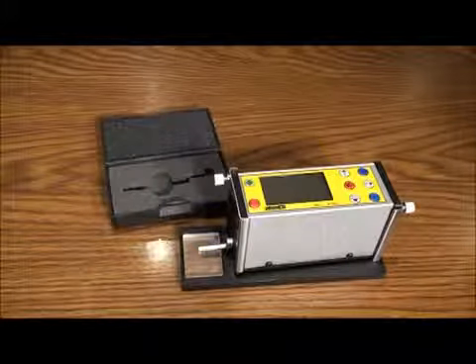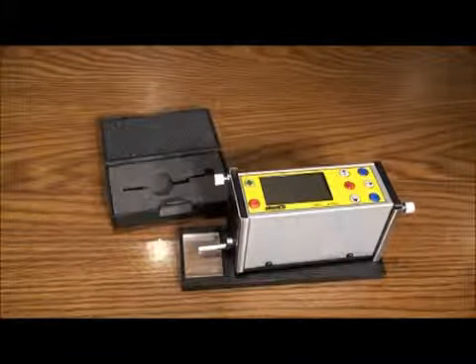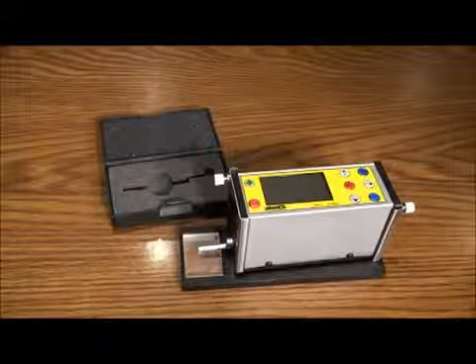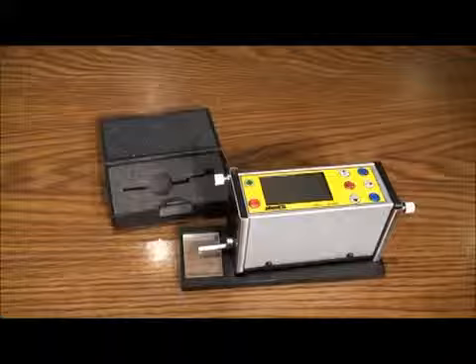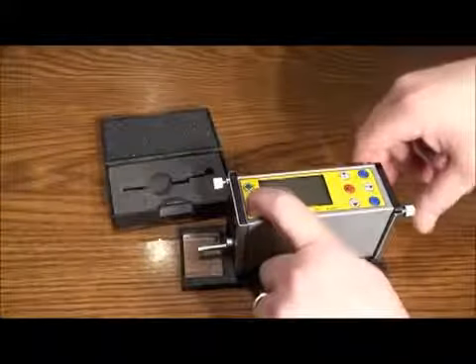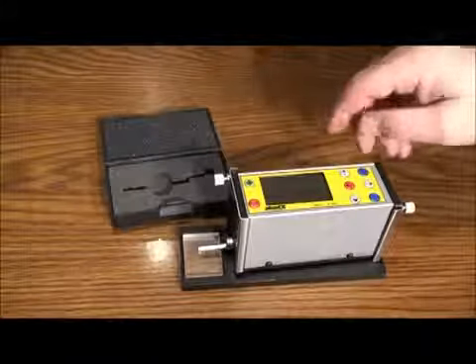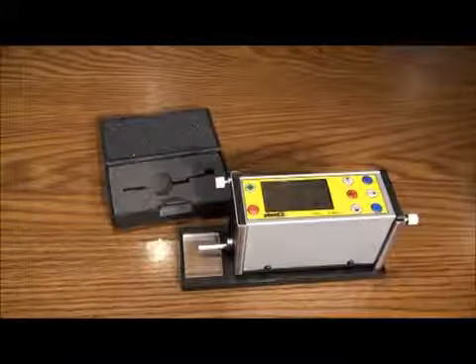Make sure there are no foreign objects on the calibrated sample before testing. Power the unit on from the rear of the unit and also the red power button on the keypad.